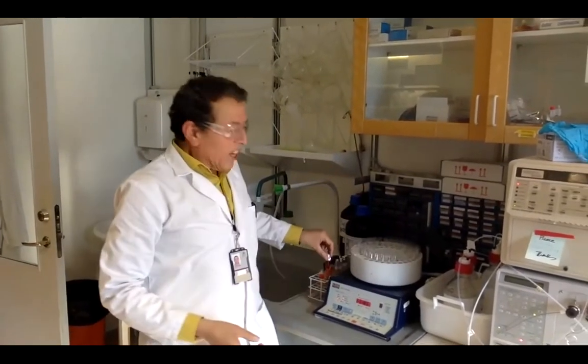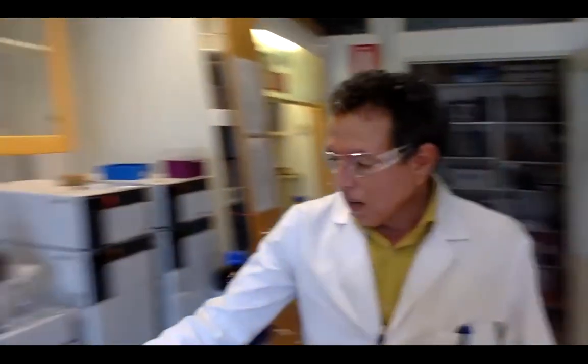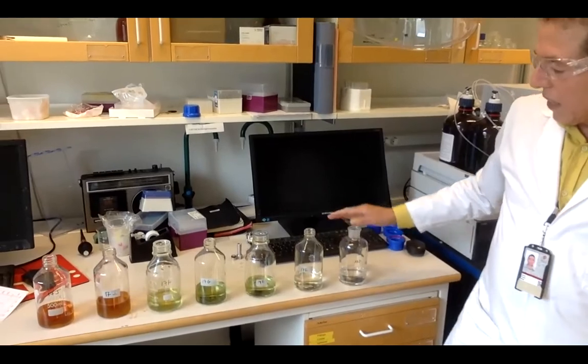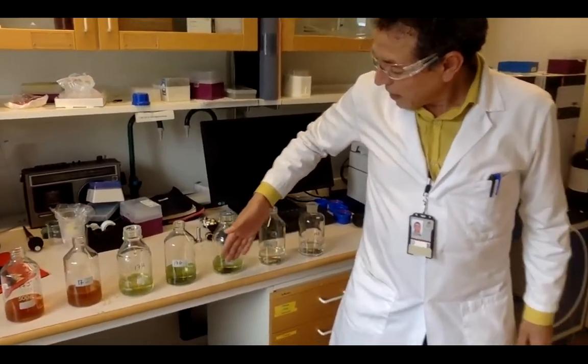The whole operation takes only about 100 minutes. You can see another example starting from low polarity to high polarity. You can see the color—colorless, green, and ending with brown.